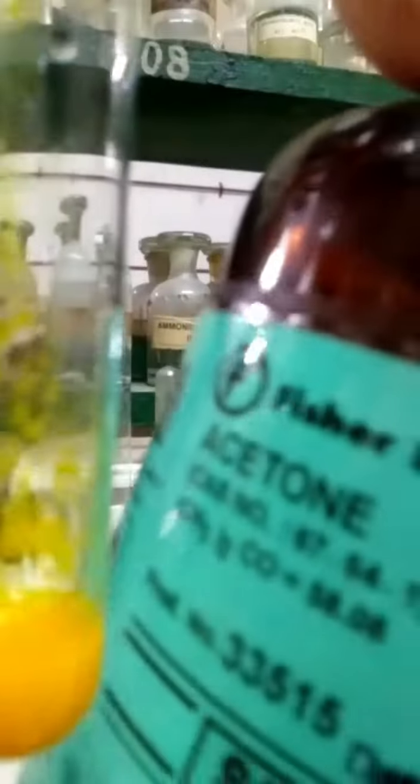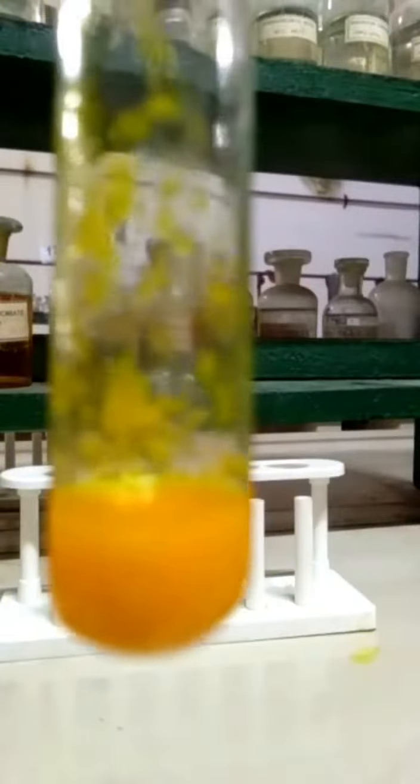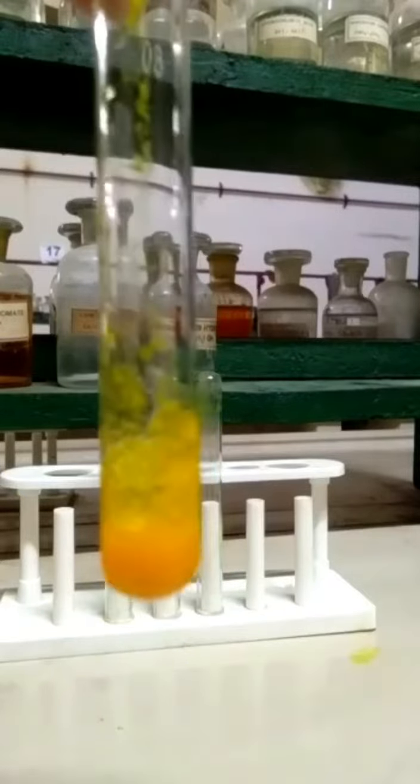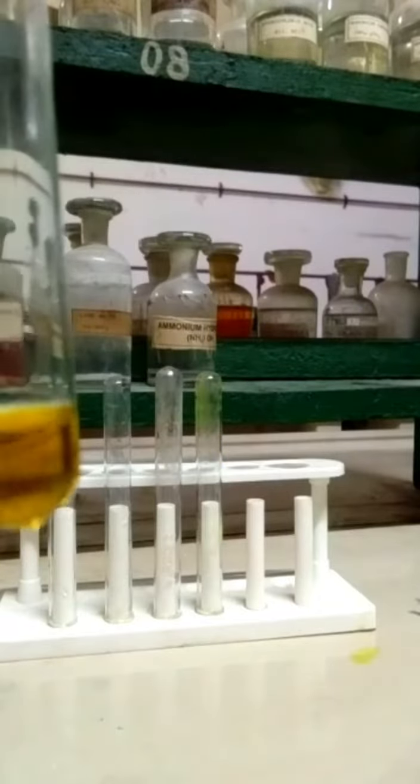Now be careful when performing the DNP test for acetone - you have to add a very small quantity of organic sample into the DNP reagent because the DNP derivative of acetone is soluble in excess acetone.